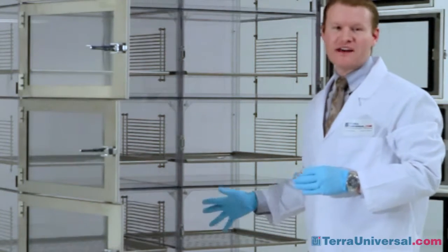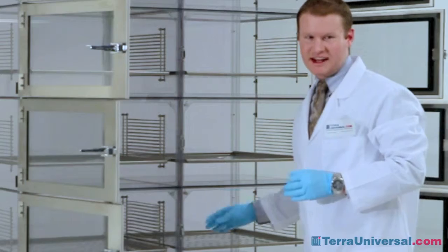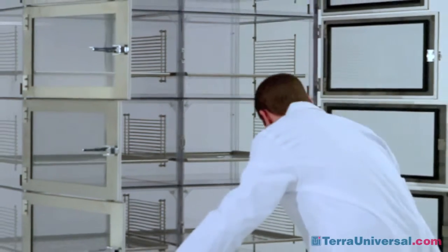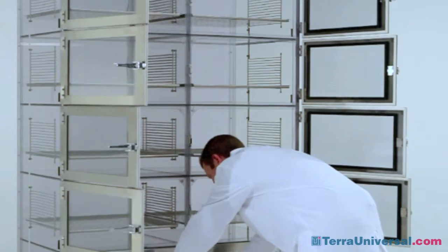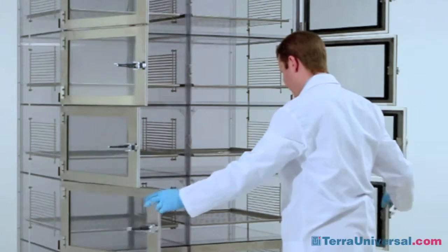Starting at the bottom and ensuring that the stand is flat, I will close each of the doors, once again ensuring that the door latch is centered upon the corresponding catch.